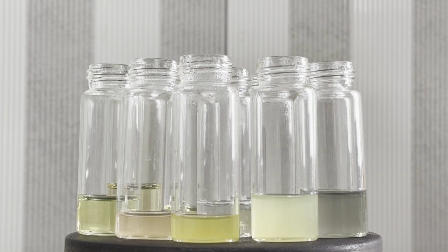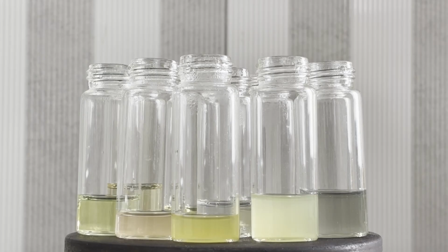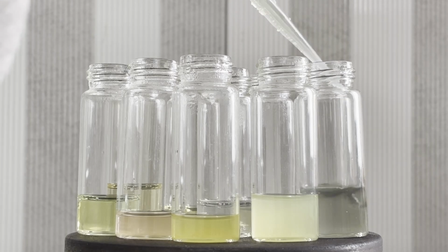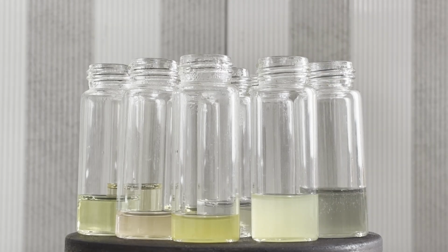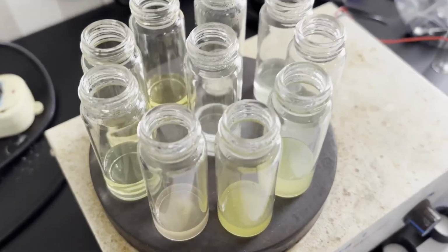However, the colors from the table vary rather significantly from the real colors that we observed here. Apparently, gadolinium and dysprosium have a slight yellow tint, erbium's color is more orange-red than pink, thulium's color appears more green than yellow, and ytterbium also has a yellow tint. I don't know if these variations in color are due to impurities in the metal or simply because of dissolved nitrogen dioxide, maybe even both. But the one thing we can learn from this is that color descriptions in literature are often not that accurate and strongly dependent on subjective judgments, so don't rely on them.